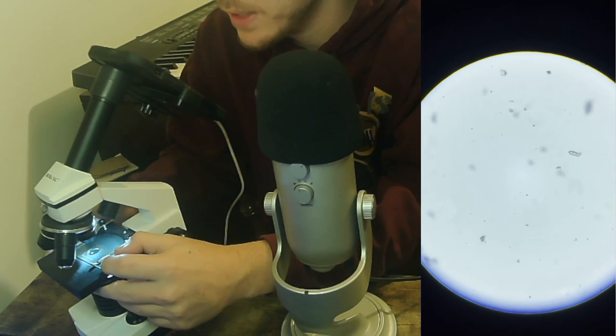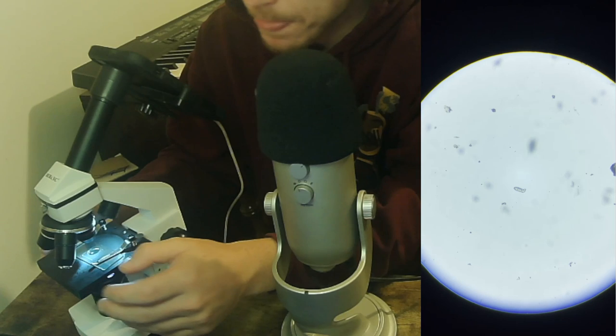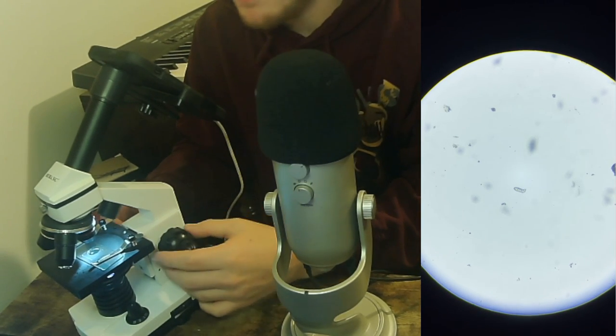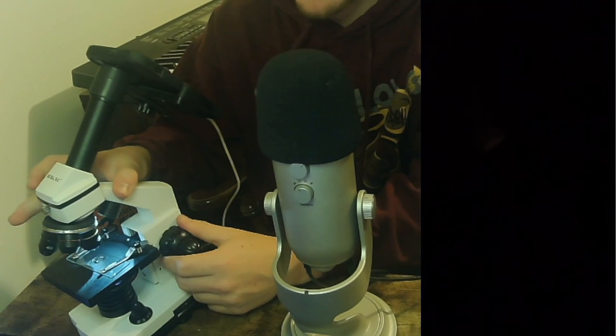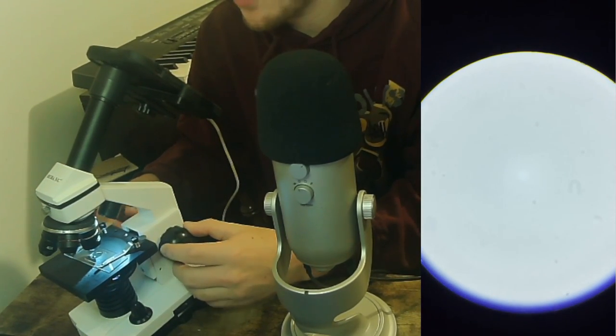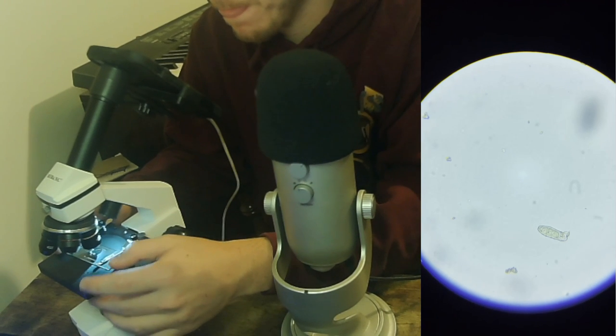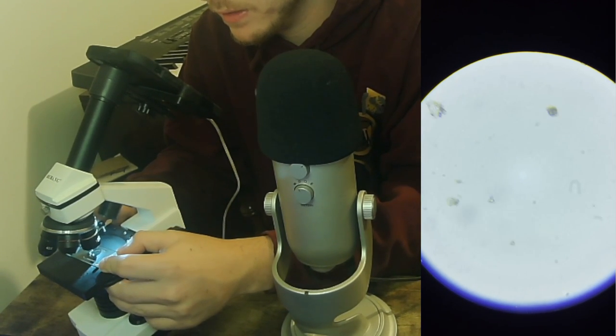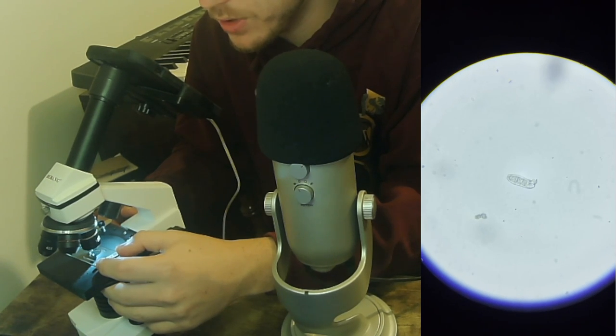This looks interesting, let's zoom in on this guy. So how you zoom in with a microscope, you have to take the stage down, move it down a bit, move to the next zoom, and then readjust the stage until it is focused again. And there it is. So that right there is the little guy that I had zoomed in on. Pretty interesting little thing, not exactly sure what it is but that's cool from a drop of stream water.